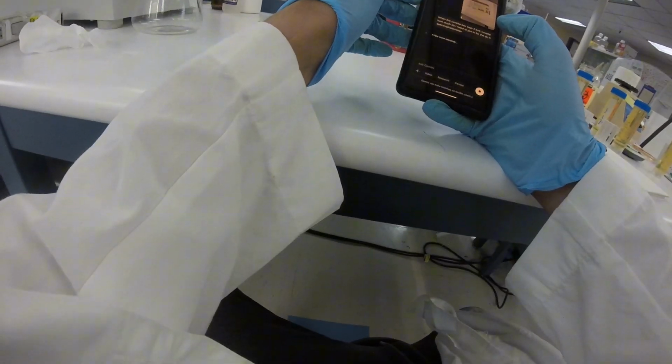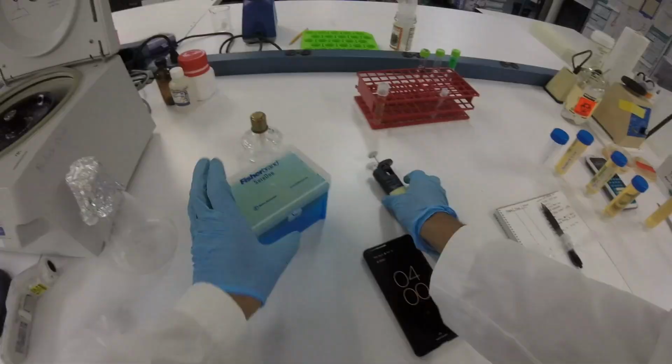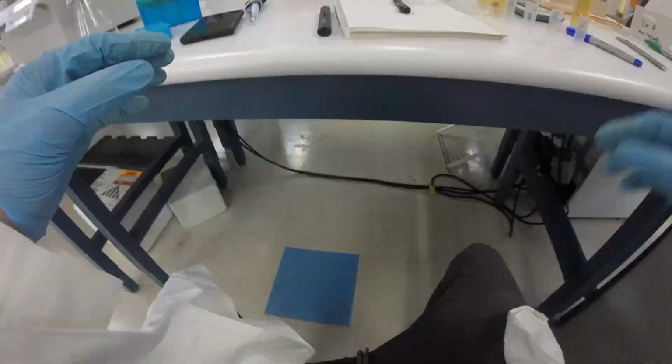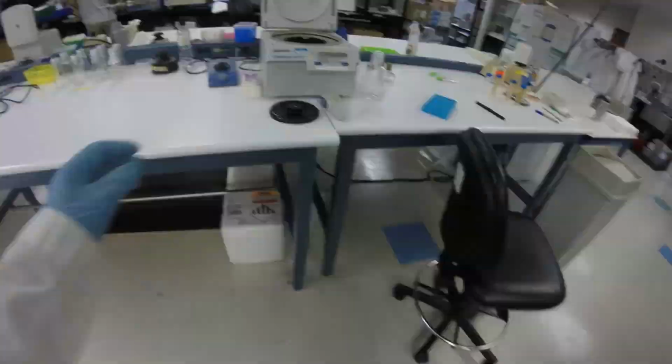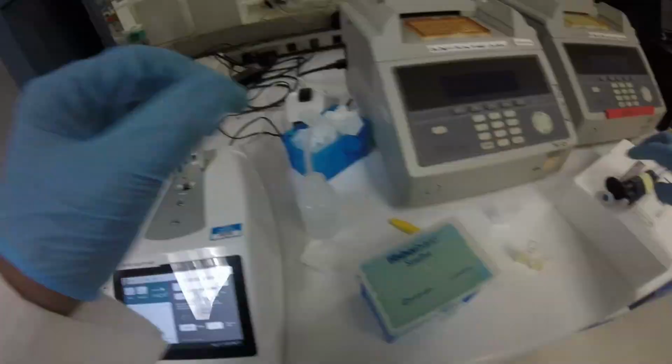Then we'd have the robot add 1 milliliter to a bunch of tubes, and basically every so often, with the tubes in the heat block, it would take one of those 1.5 milliliter Eppendorf tubes, take a milliliter from that and put it into a cuvette in some custom labware that I designed. I don't know if there's a way to give input into the OpenTrons, but basically what I would like is for it to fill the cuvettes.